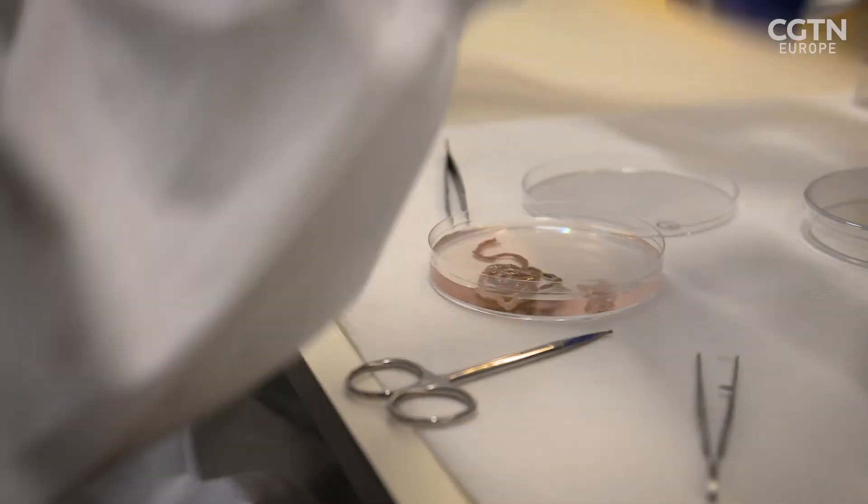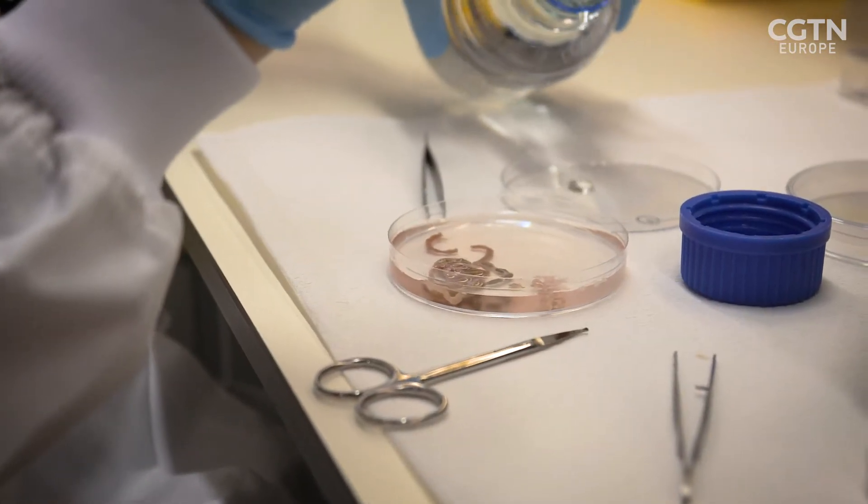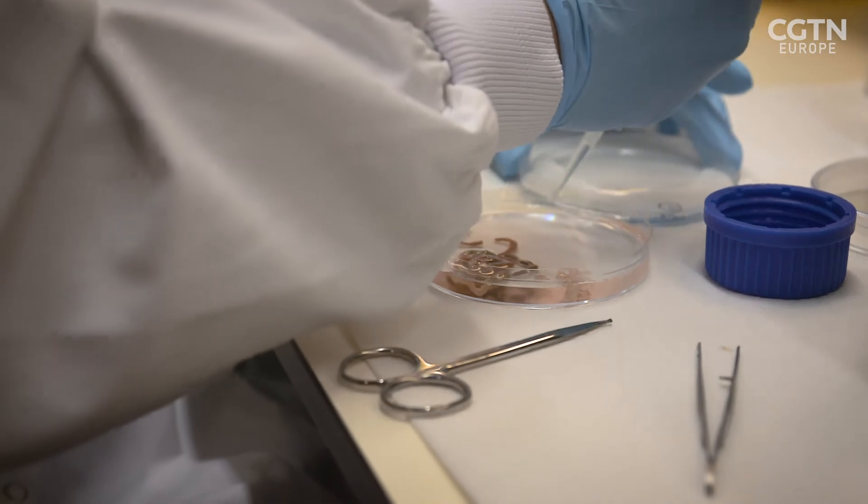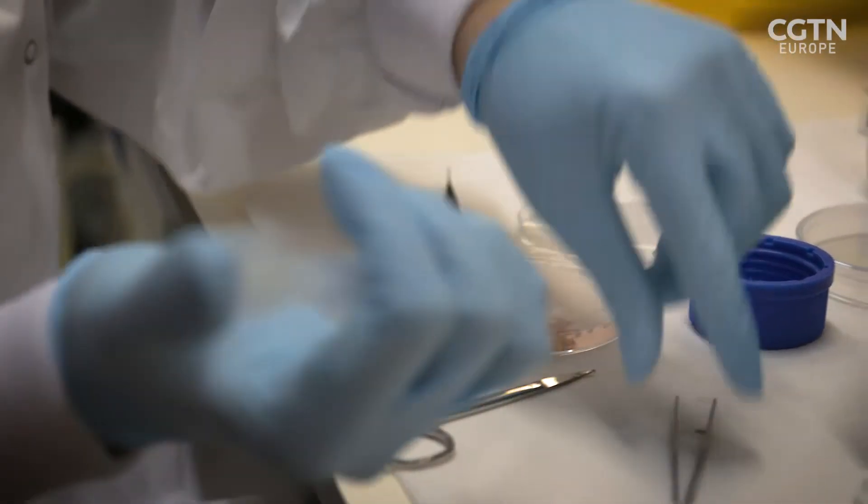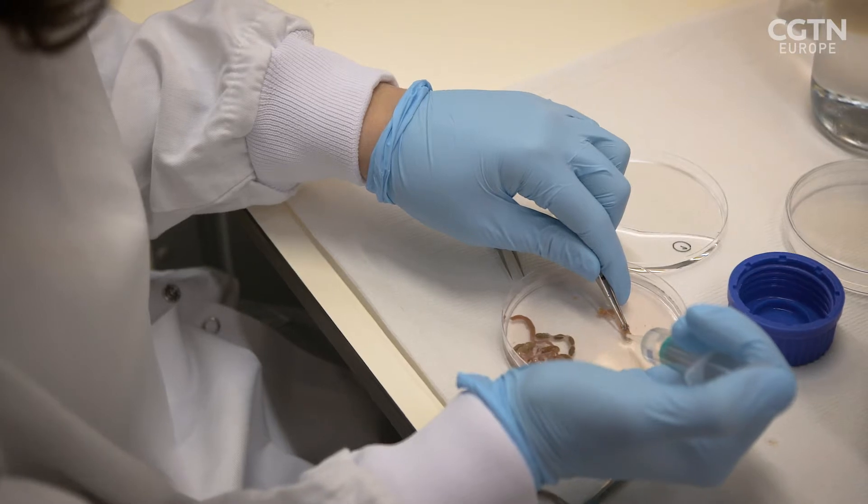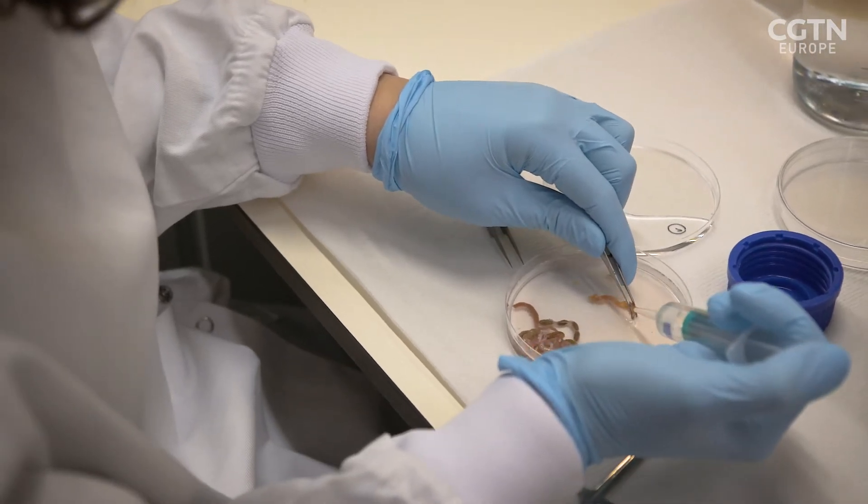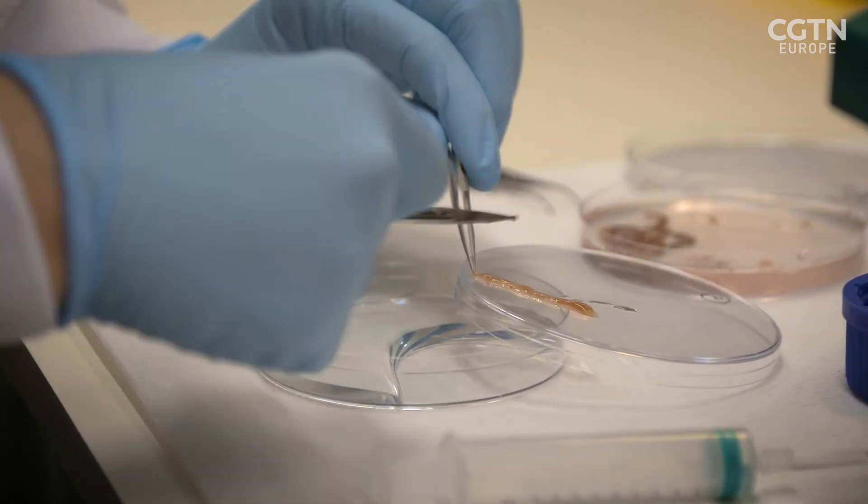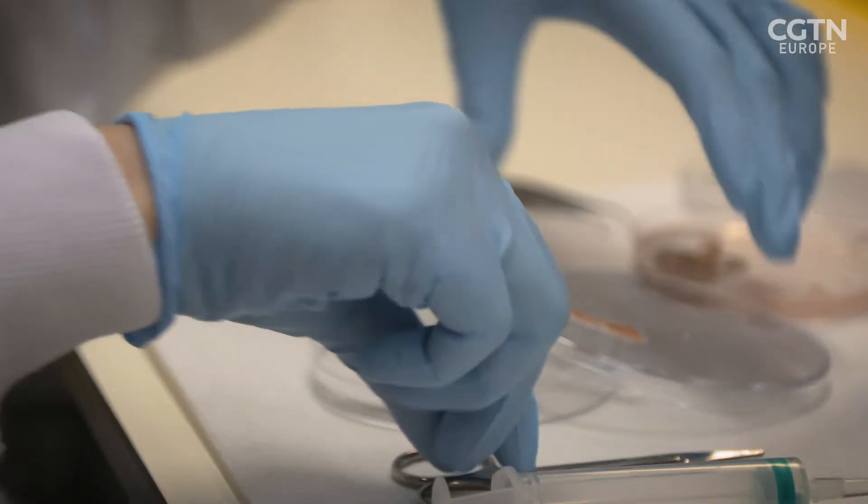What are you interested in? What's the essential parts for your research? The cells. This is a gut tube, so inside is an empty tube lumen, and we're interested in the cells covering the internal part of the gut. She's going to clean it up first. She's opening the gut tube now and we're getting into the cells that we're interested in.